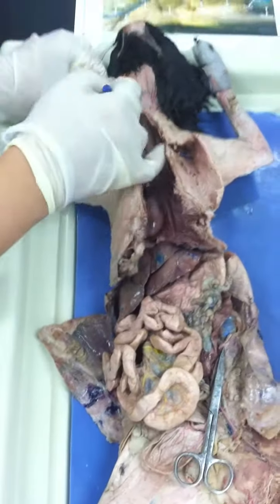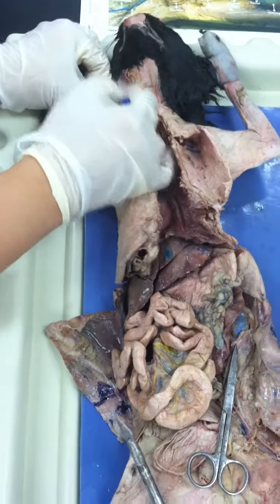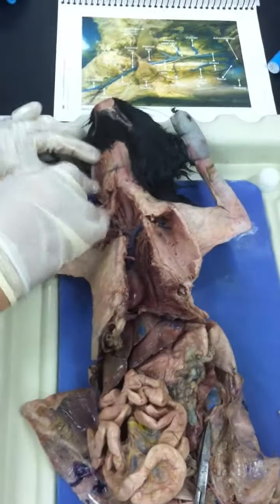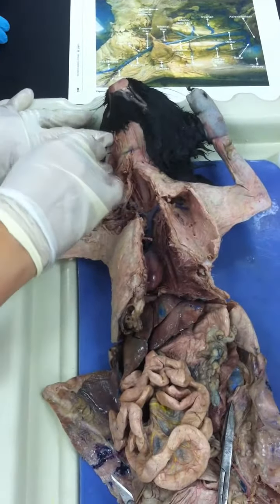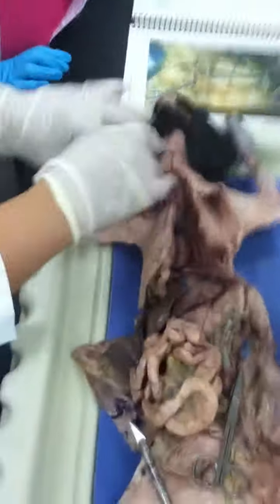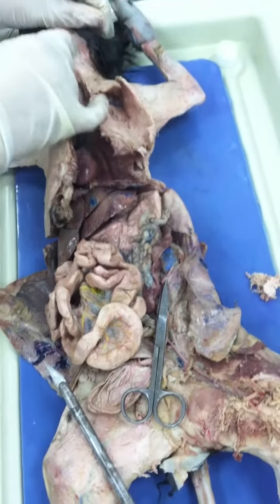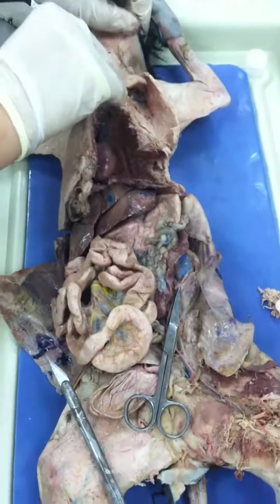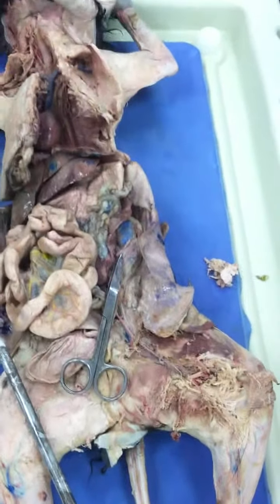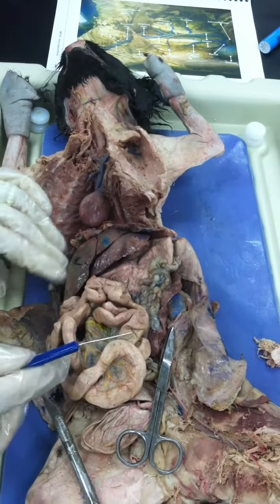We need that probe. Yeah, we need a probe. We were afraid we were going to cut them. I'm going to see in the back if there's any more probes. Thank you. Yeah, because with the probe you could separate it, that way you don't sever. You need to continue dissecting. I think this side is going to be easier. The left side of it? Oh, yeah, you can see it. You see it? Yeah. So you have to take out the entire skin and then continue dissecting. You see the anterior and posterior.